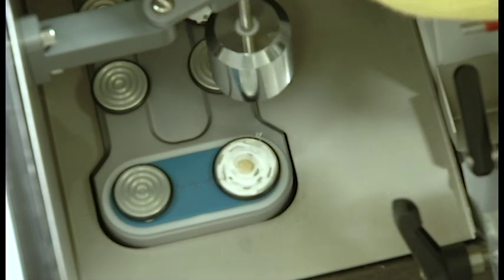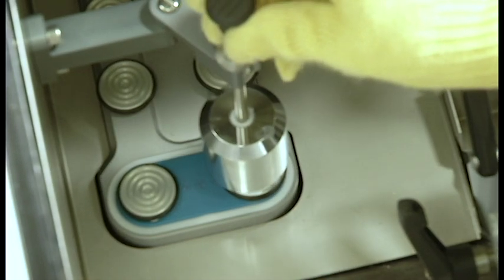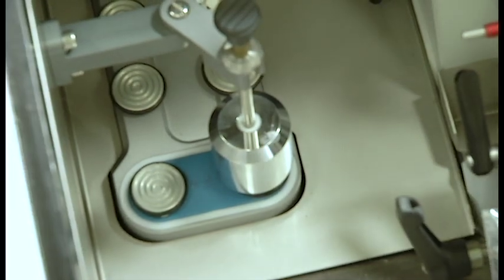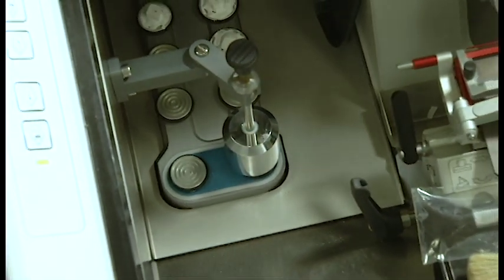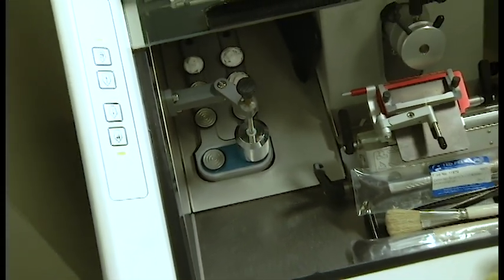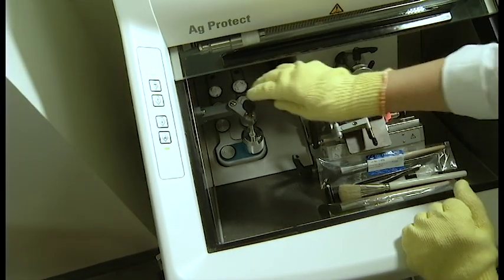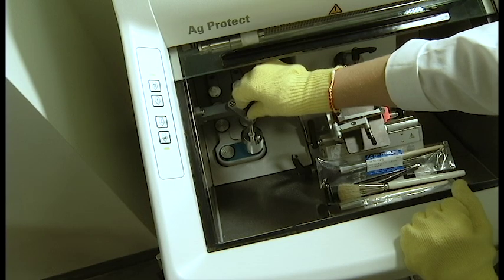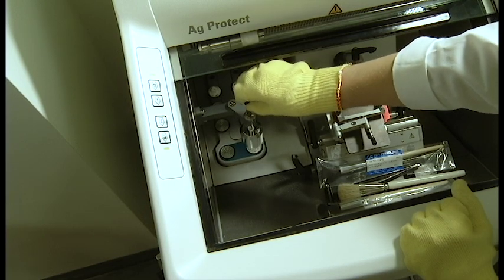When you remove the bar, you will notice that the tissue has been slightly flattened. This method is not good for tubular tissues or tissues that you need to orient specifically or for delicate tissues. It is really ideal for large organs like the kidney or liver where you are just looking for a cut of the tissue and do not need the sample upright.